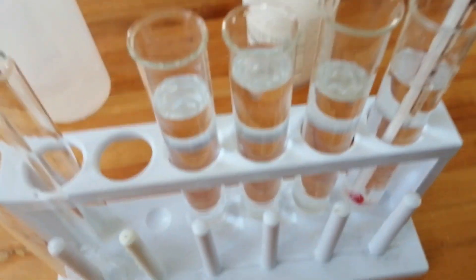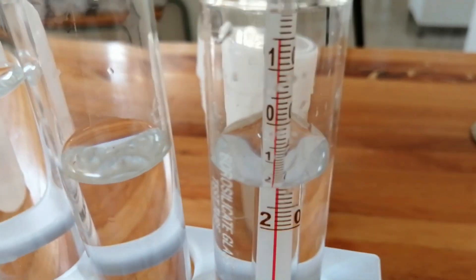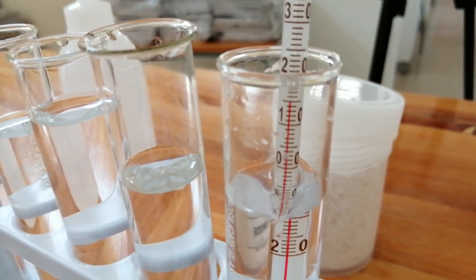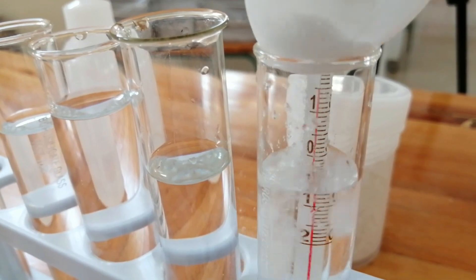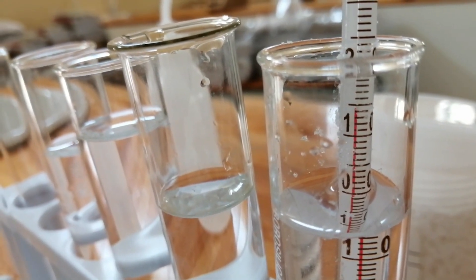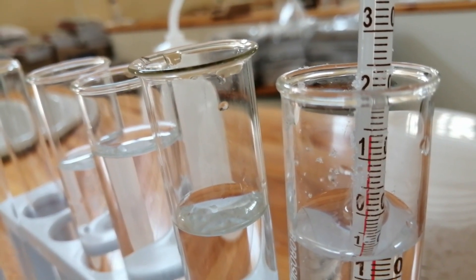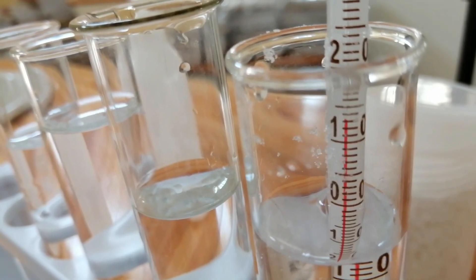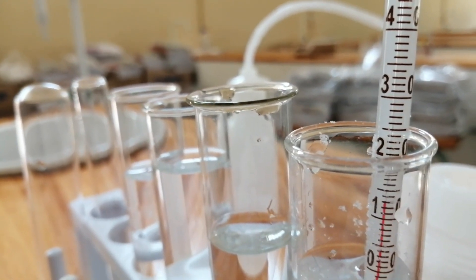Let's add some more potassium nitrate granules and check the temperature again — you can see it's 15 degrees. I'm going to add some more potassium nitrate granules; watch whether the temperature is going up or down. We can clearly see the temperature is going down — now it's 14. Let me shake it a little bit. Yes, it's going down. It was 20 degrees at the beginning.